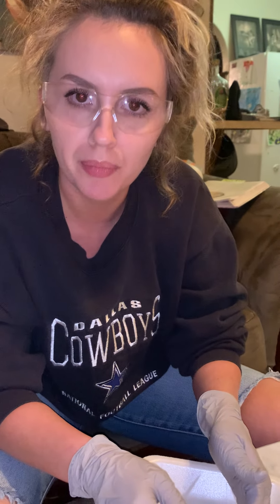Hi, my name is Michaela Hediger and today we are going to dissect a sheep eyeball for anatomy and physiology part one.